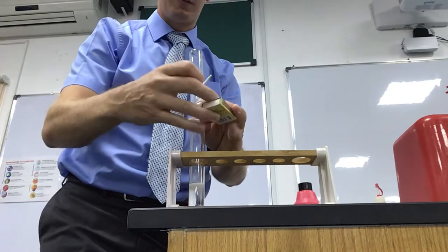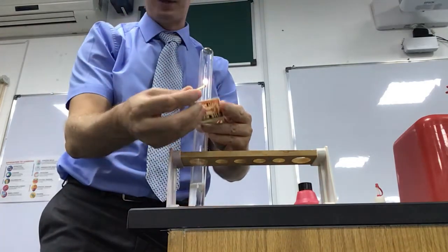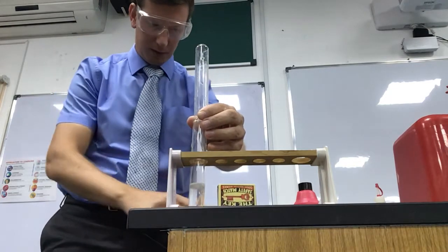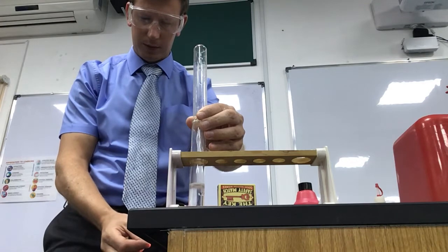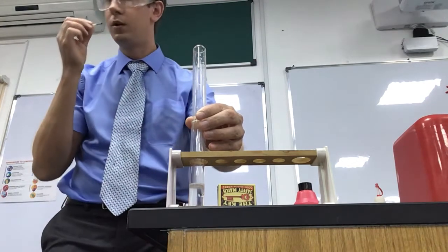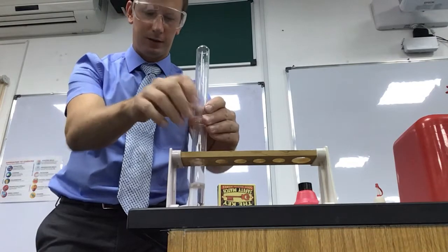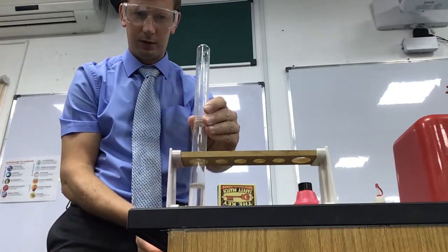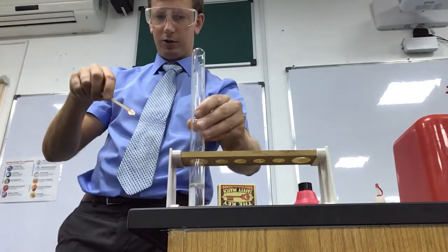It's often easier with an assistant. What's happening is the hydrogen is rising up through the test tube and going to the top of the second one, so the hydrogen is coming up and gathering in the top of this boiling tube. I'm going to give it a little bit of time to make sure we've got enough.